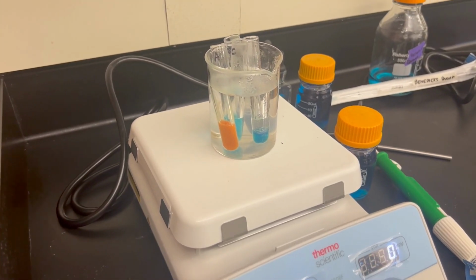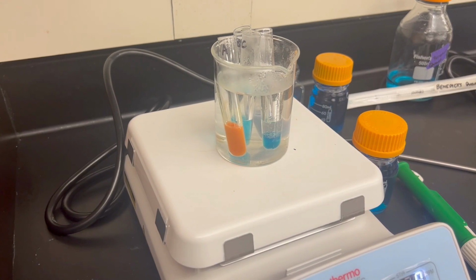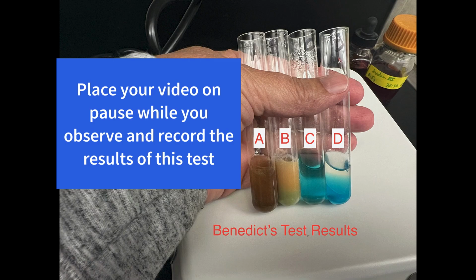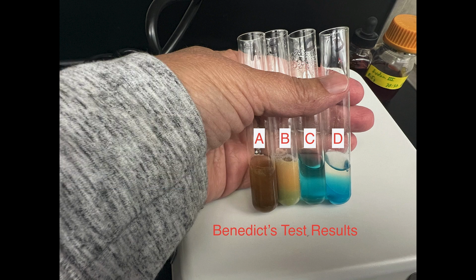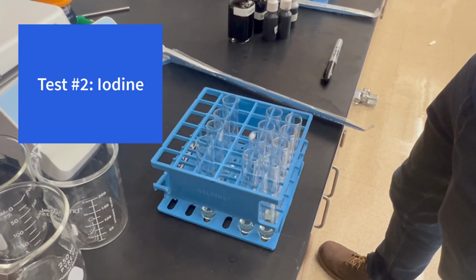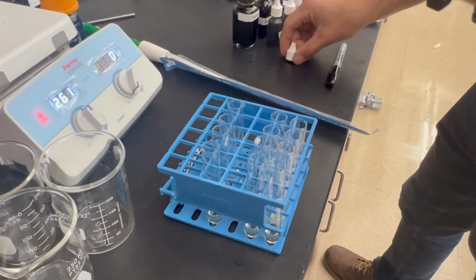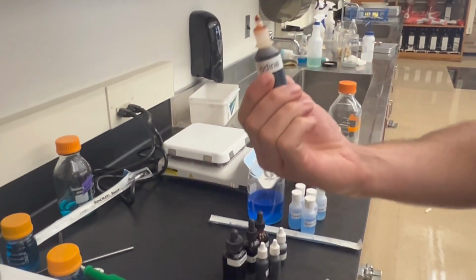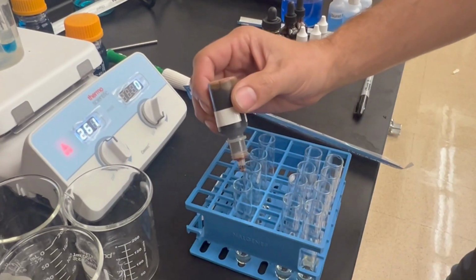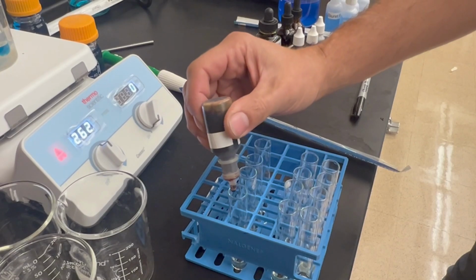It's only been a minute or two, but we already see a color change in one of the vials. For this next test, we're going to be testing for presence of starches. Be sure to not get this on your clothes or hands as it will stain. We're going to add about 2 drops to each one of these vials right here.